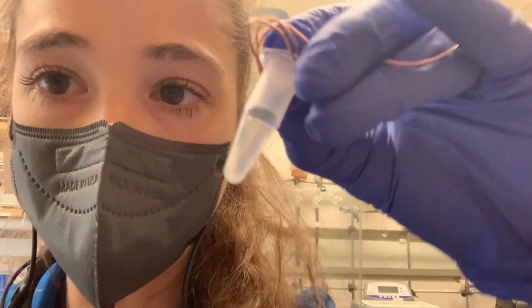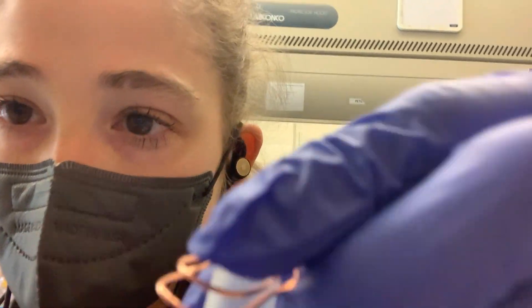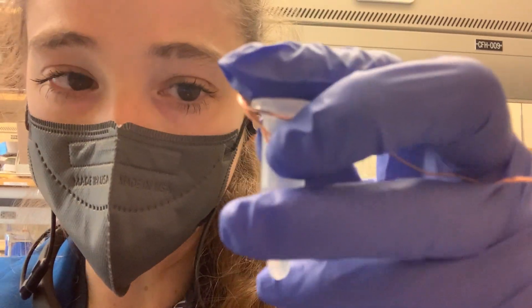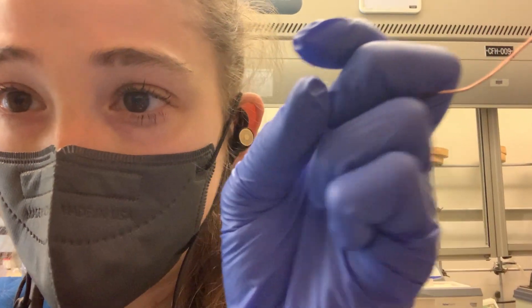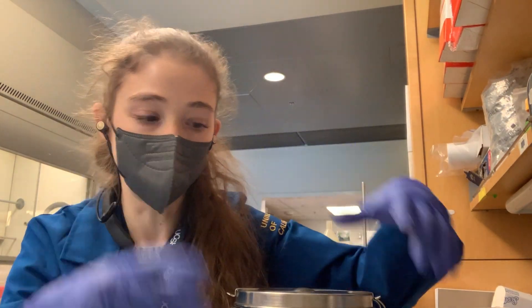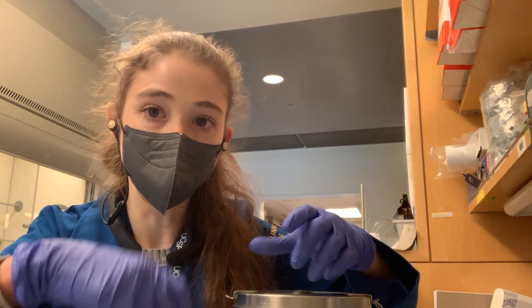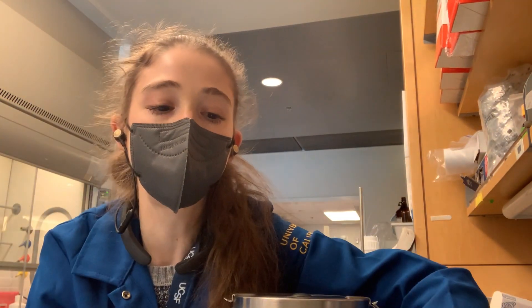When you're tying, make sure you're not touching all over the bottom of the tube. You can even tie it beforehand and then pipette your sample in — you just want to make sure you're not having your warm hands all over the tube when you're trying to freeze the sample. I've heard of people using fishing net: put a fishing net in and then freeze the tubes, then pull them out. But then again, you still have the problem of keeping things perpendicular.